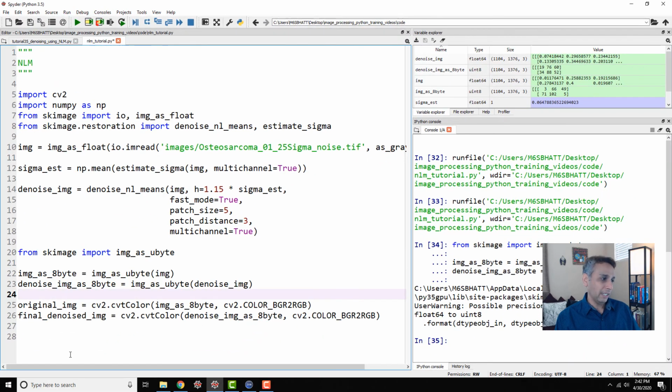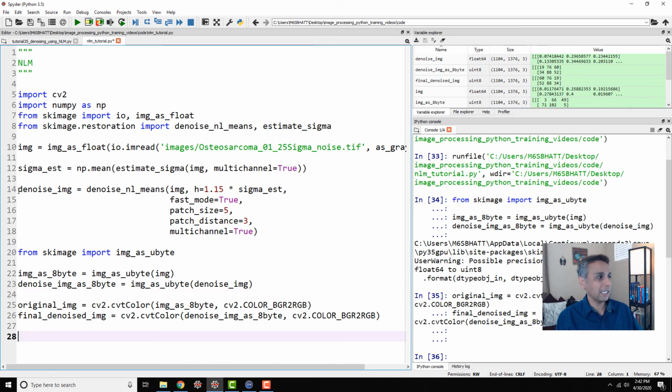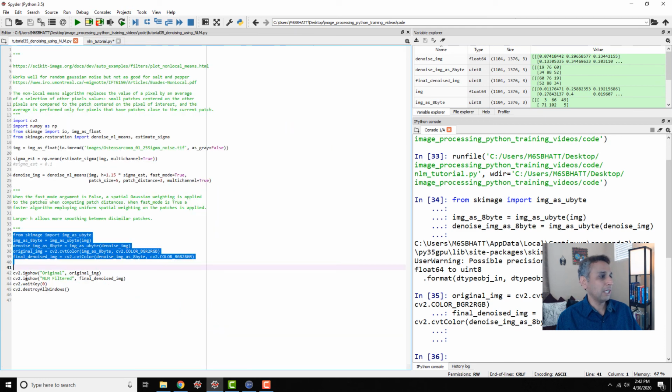Now, one other thing: if I'm going to use OpenCV to visualize my images, as I demonstrated a few tutorials ago, our images are going to look a bit weird because our blue and red channels would be mixed. Remember that OpenCV handles images as BGR and not RGB. So let's convert our images from BGR to RGB, and that's what these two lines do. Let's run these two lines. Finally, and again, this is all just post-processing. The denoising is done right there. I'm just cleaning up so I can see it better. Now we are all set to visualize the images.